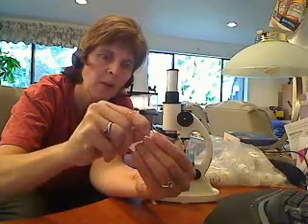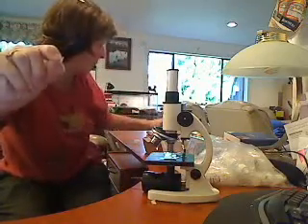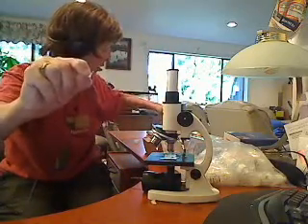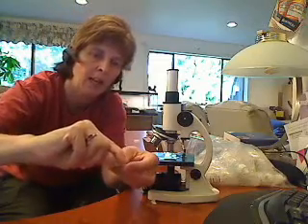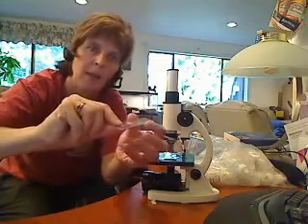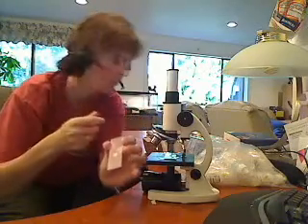And a little — careful, careful with your fingers — you can peel a tiny layer off the inside. Then you're going to get into your slide box, grab it and gently, gently tap it down on the slide. You don't want to damage the cells. That's the point.